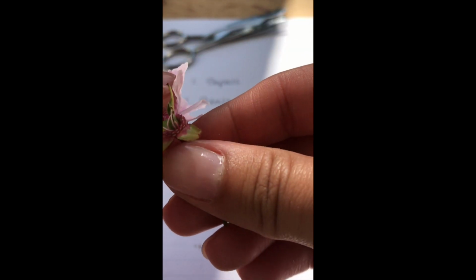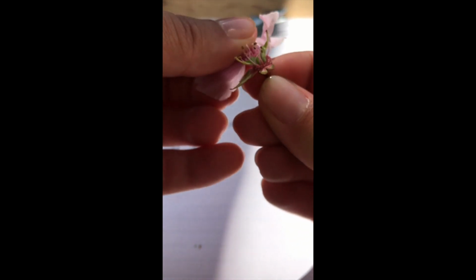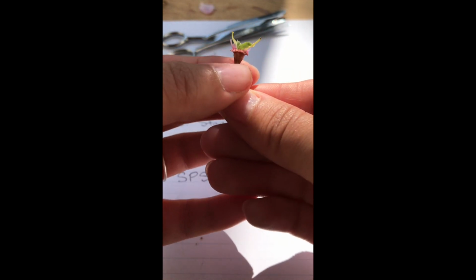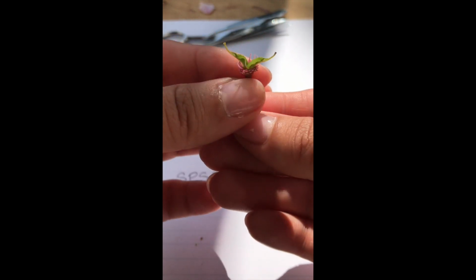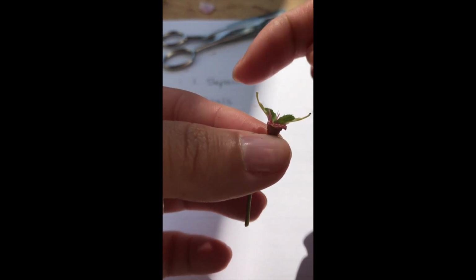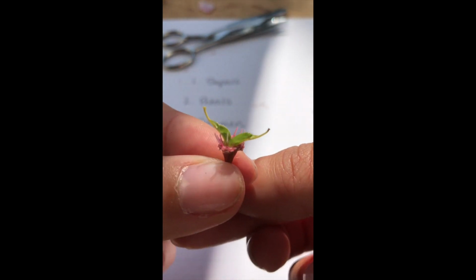This flower actually has 2 pistils, and I'll make it really easy to see by pulling away all of the stamens and all the petals, so that all that is left is just those pistils. So if you see, there's 2 little green, they almost look like little arms reaching up towards the sky. Here's one right there and one right there. So those are actually the pistils on this flower.